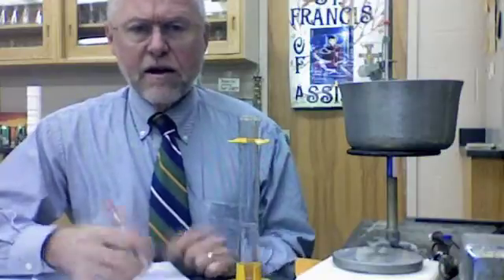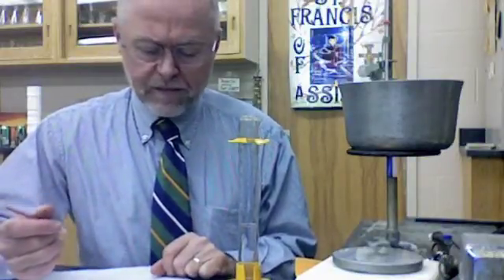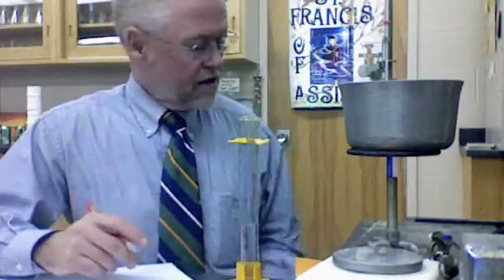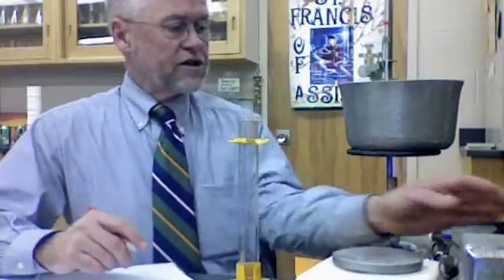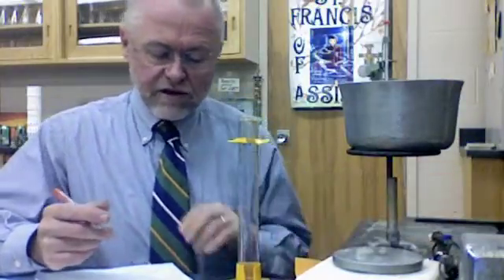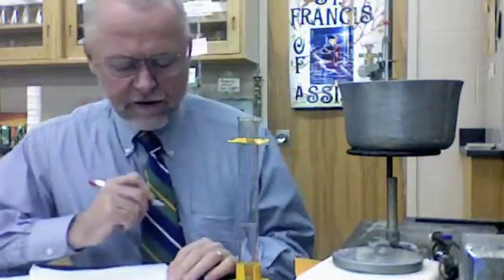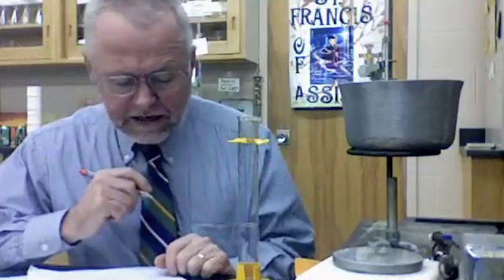So now I have all the data that I need. I'm ready to do the calculations. I'm going to go through the calculations briefly so that you'll know how to do them in case you have trouble. I'm going to shut this off because I'm done with this now for my part. So the metal is zinc. We've got that cleared up now, so put that under metal. Delta T for the M. That would be, you know what delta means? In this case it means change. Change the temperature for the metal.